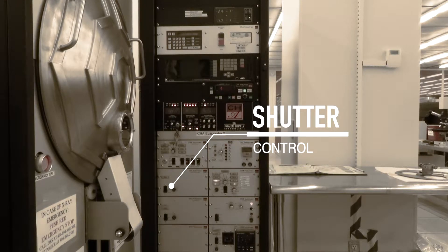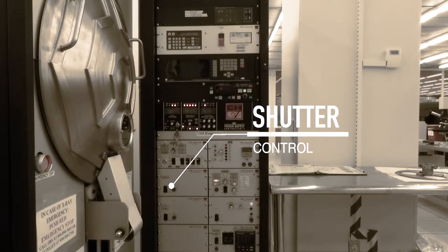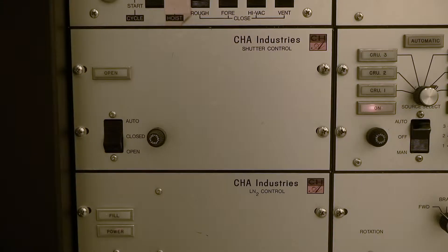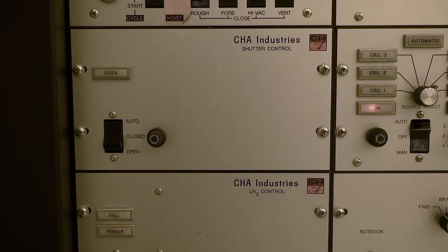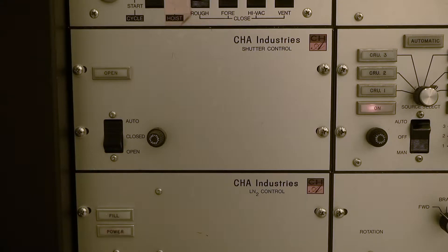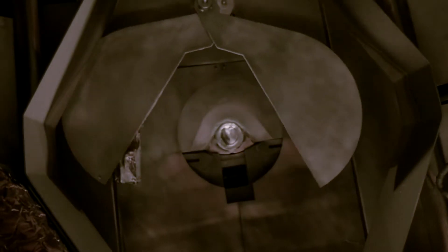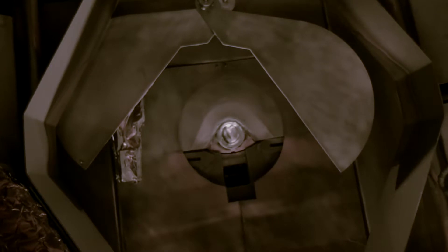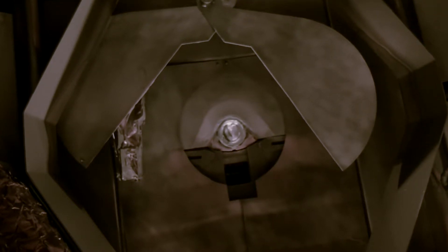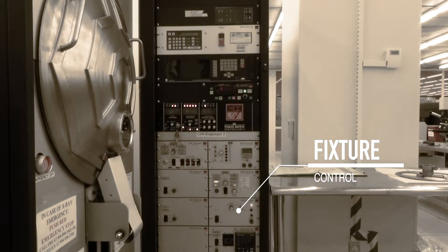The shutter control opens and closes the shutter. Ordinarily, the shutter is controlled by the deposition monitor. The shutter is closed while the metal being evaporated is heated. Once the metal is evaporating at the correct rate, the shutter is opened, exposing the sample to the evaporation. Once the desired amount of metal has been deposited, the shutter is closed to prevent further deposition.